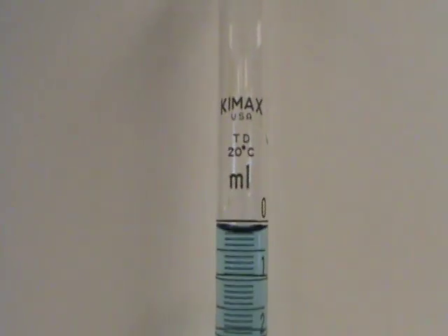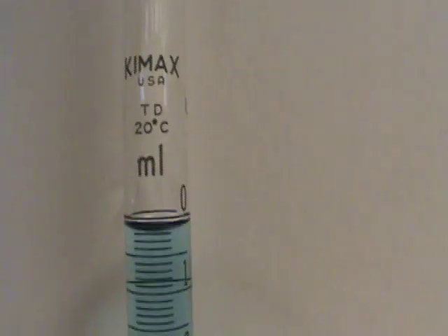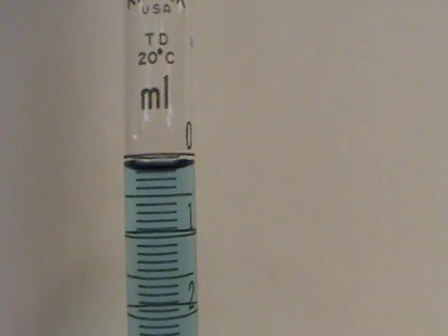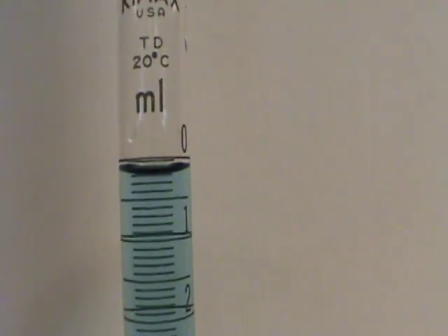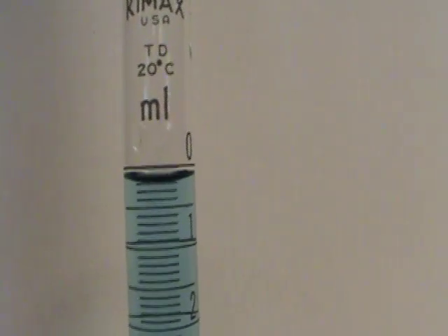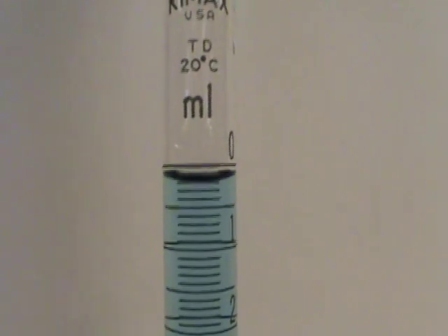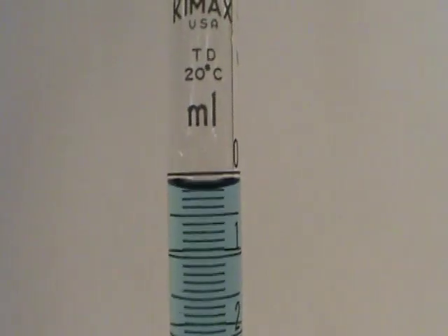Now let's go all the way back up to the top and how do we read what's going on here? Well, because of its surface tension, water forms a meniscus, and you can see that right there. So where on that meniscus do we read — the top or the bottom? It's usually best practice to read the bottom of the meniscus.